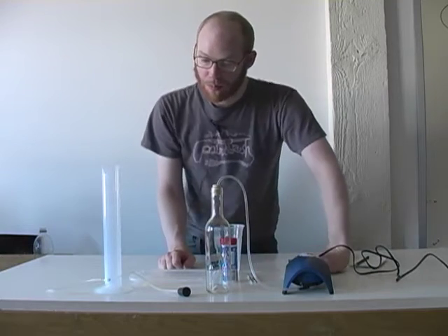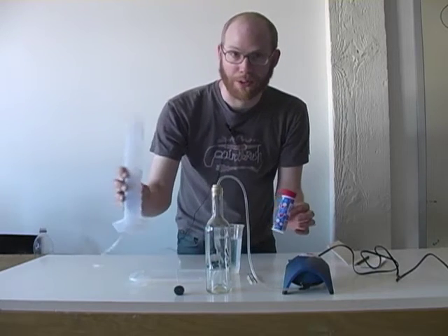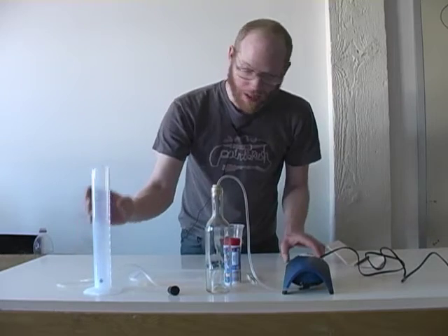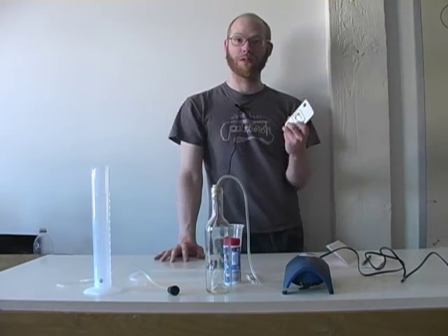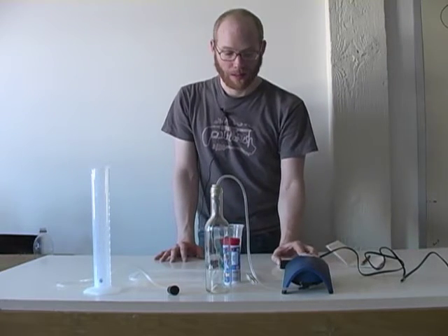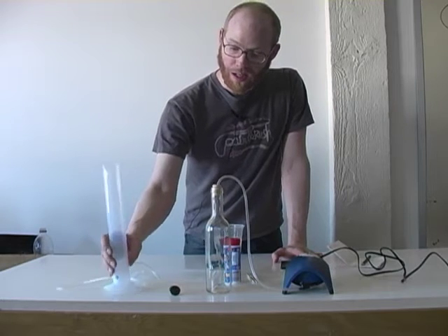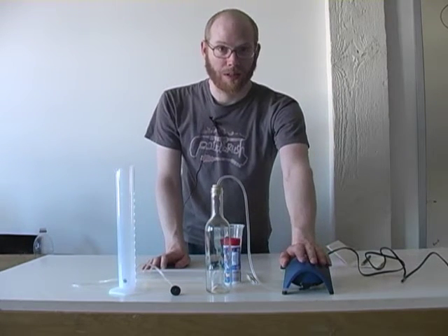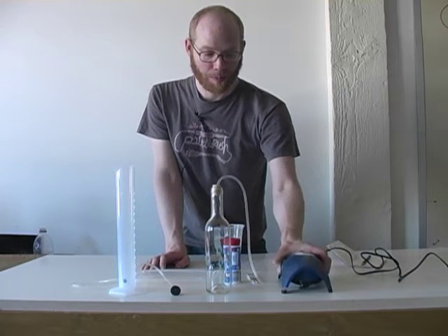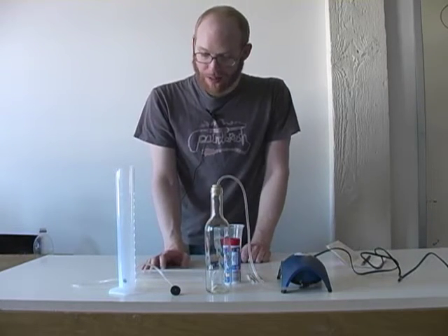We're going to use a very simple method which is to draw a bubble using just bubble solution down a graduated cylinder. We'll time that operation and write down our readings. Our goal is to measure exactly 0.3 liters or 300 milliliters worth of air per minute moving through this aquarium pump. Then we'll be ready to run our tests on our formaldehyde sensitive tubes.